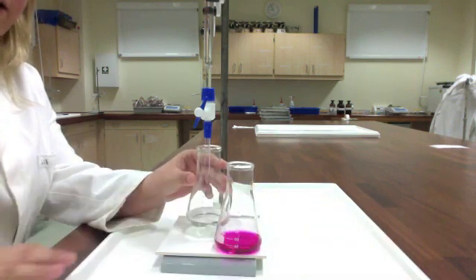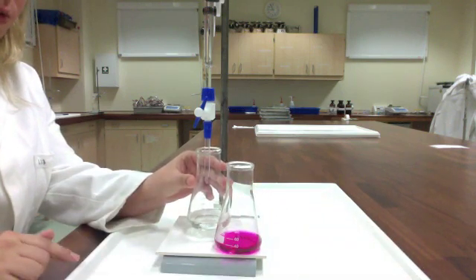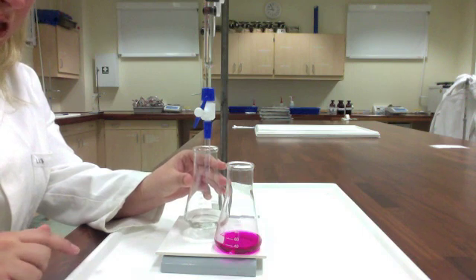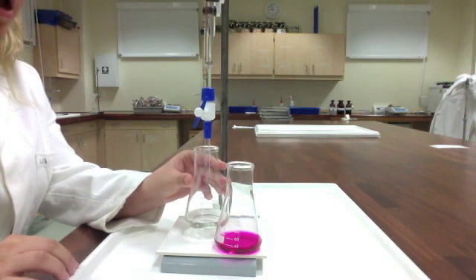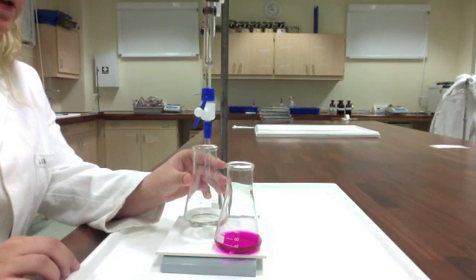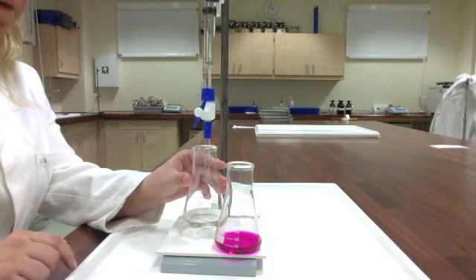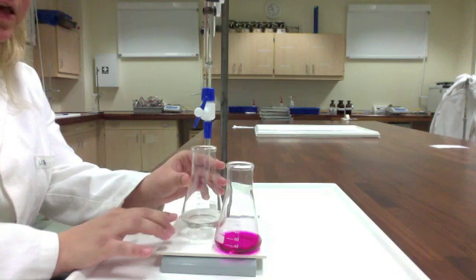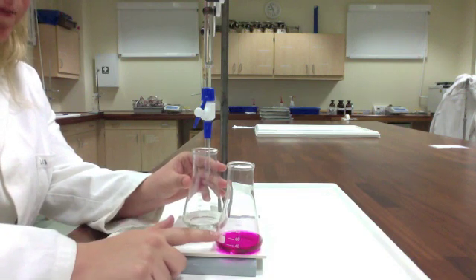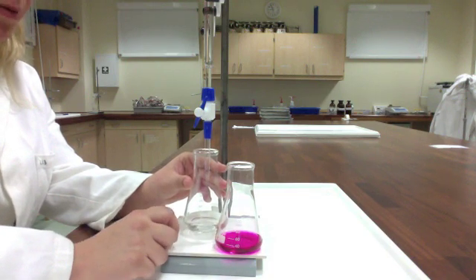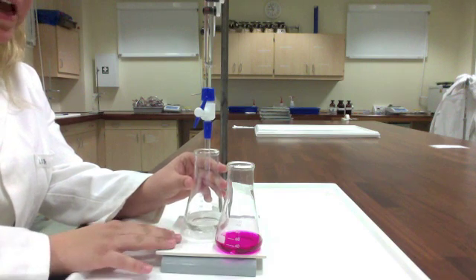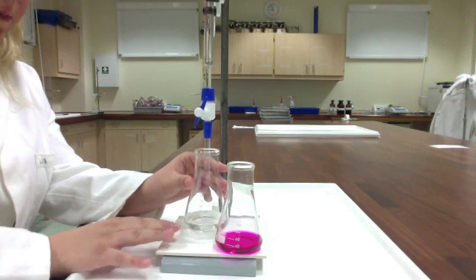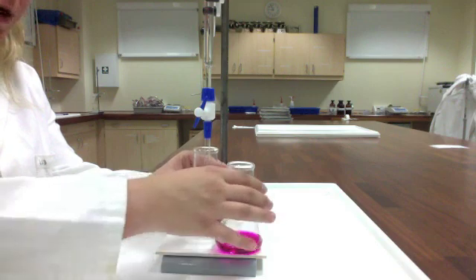Again, let's remember this guy. That was our fast titration. That's way, way too dark. In our good trials, it will be the difference of one drop to take this solution from colorless to pink. And I'm going to tell you that it will not be this pink. It'll be a really, really pale pink. That's why I have this white tile here so that I'm able to see that color change more readily.